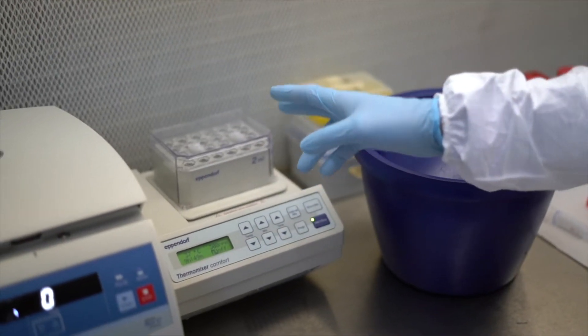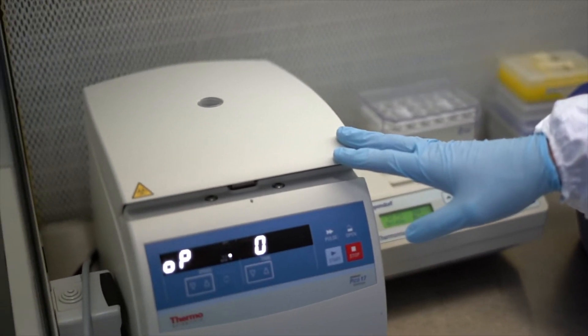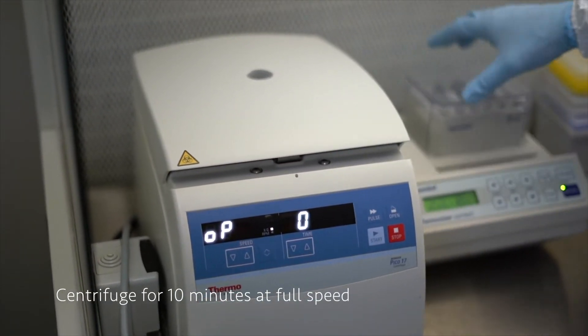First we have to centrifuge the tubes that were incubating on a bench centrifuge at full speed for 10 minutes.